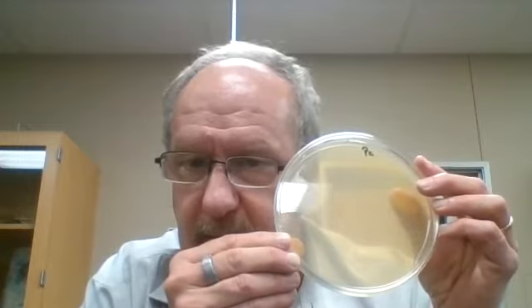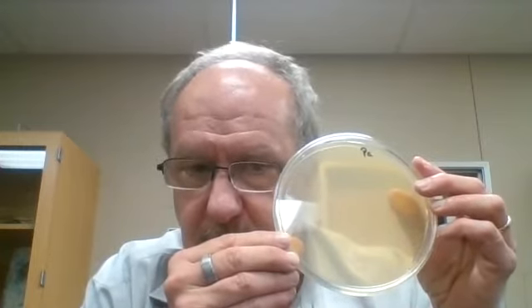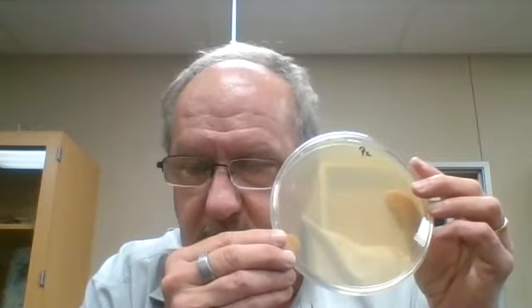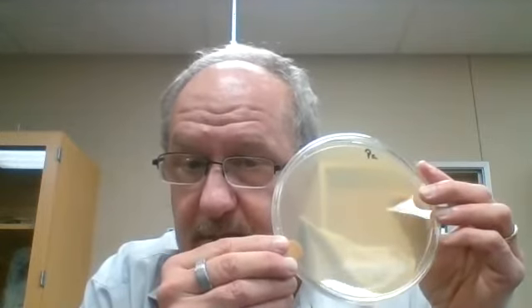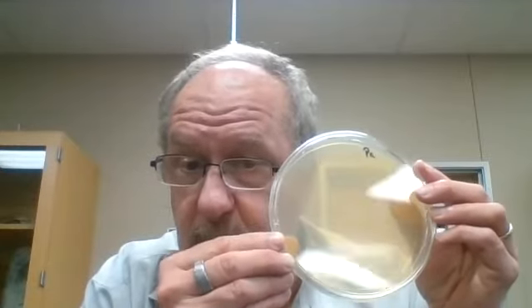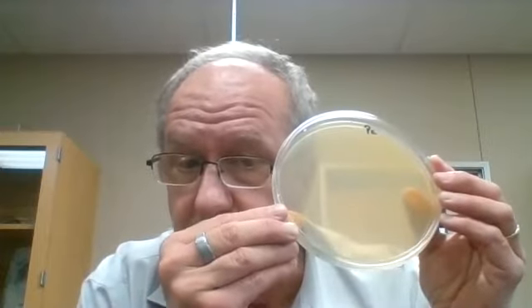I also previously inoculated E. coli, as well as Staphylococcus epidermidis. I will do the inoculation in just a minute for Pseudomonas aeruginosa, and then we will put antibiotic discs directly on the Petri dish, and we can do the Kirby Bauer test that we talked about when we talked about antibiotics and antibiotic resistance and susceptibility.